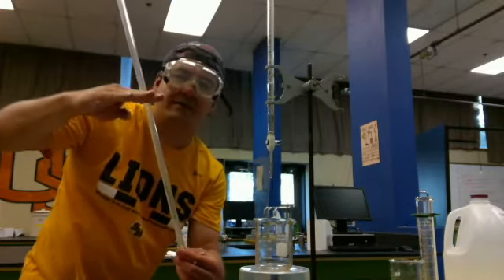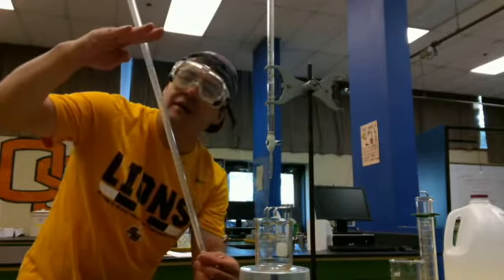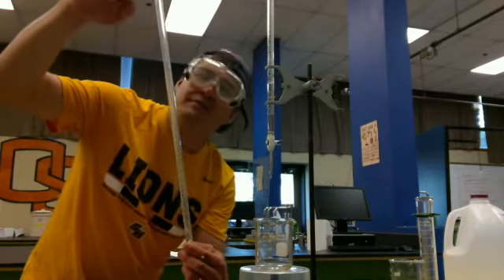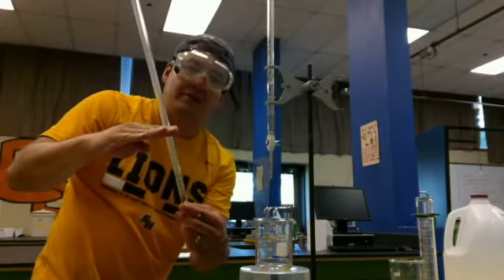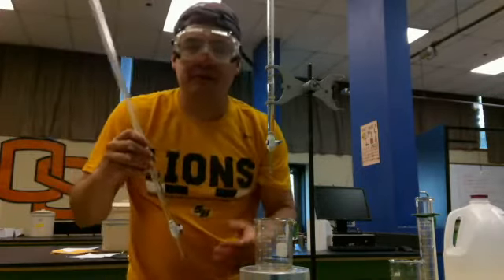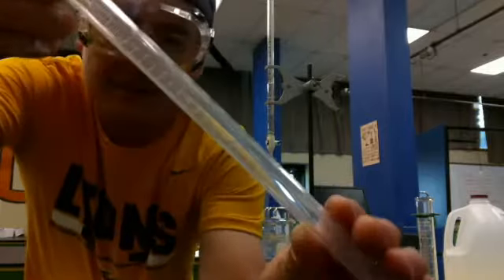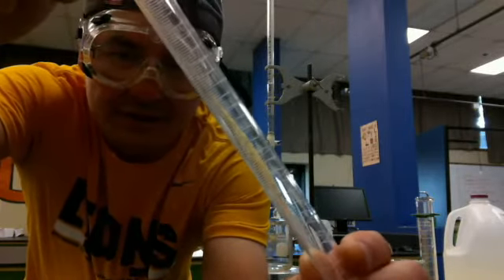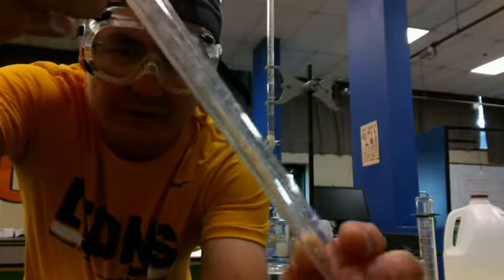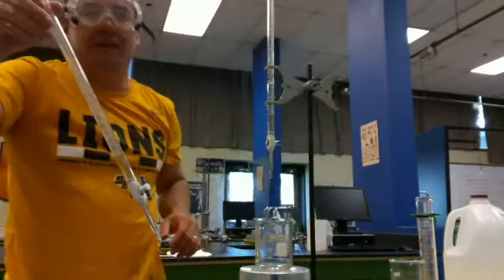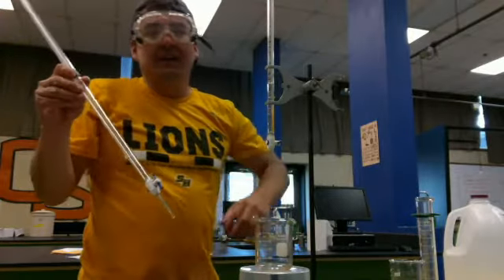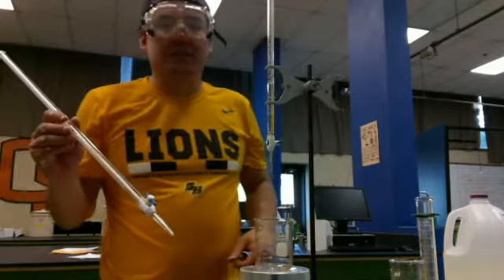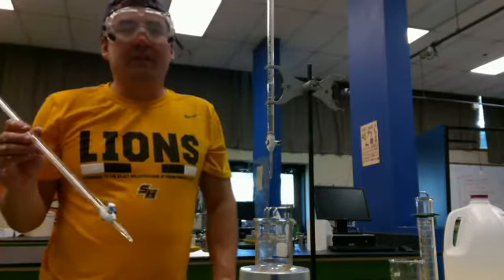And a lot of times, we won't fill it all the way to the top. So you might fill it up to the 10 milliliter mark. And if you dispense from 10 milliliters down to 40 milliliters, that's a difference of 30 milliliters. The little tiny lines are a tenth of a milliliter, and your eyeball can actually go one decimal place farther than that. So this will actually be precise down to the hundredth of a milliliter.